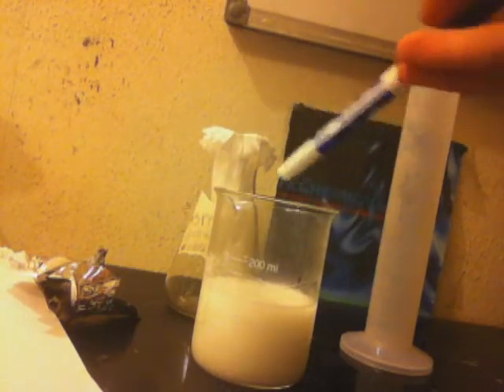If you don't get a milky white precipitate, then your reaction has failed, or you didn't add enough hydrochloric acid. Make sure all that's added. I'll try not to add an excess of hydrochloric acid because it starts fuming like crazy. So now that we have this milky white precipitate, we're just gonna take this and filter to obtain our product.